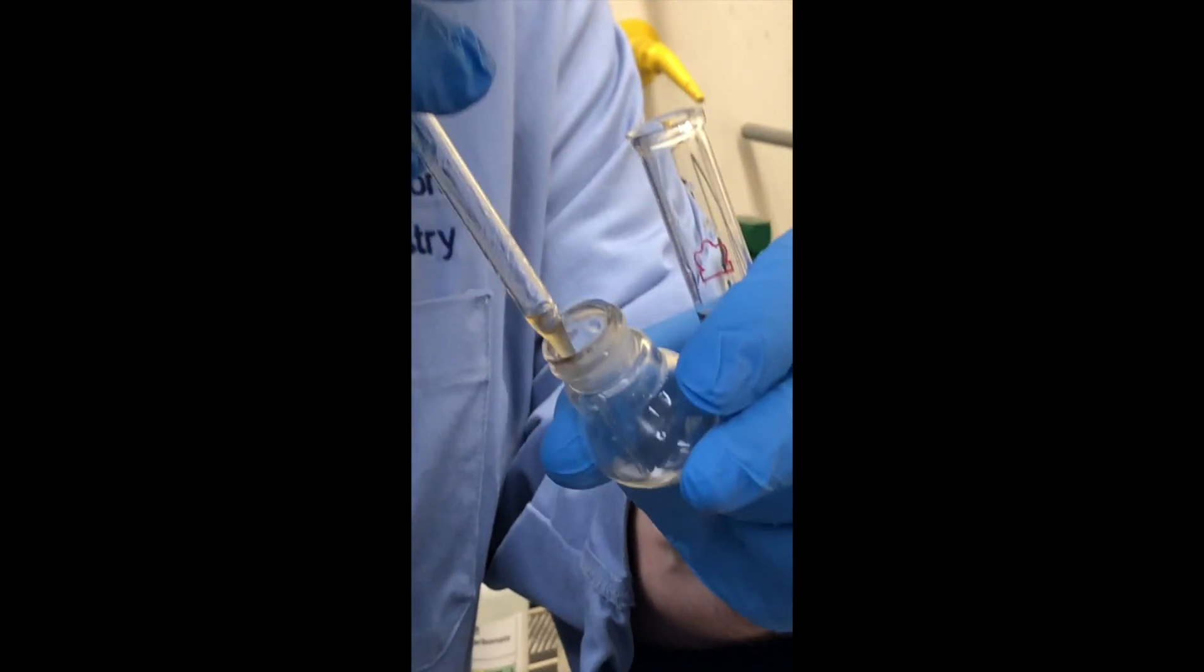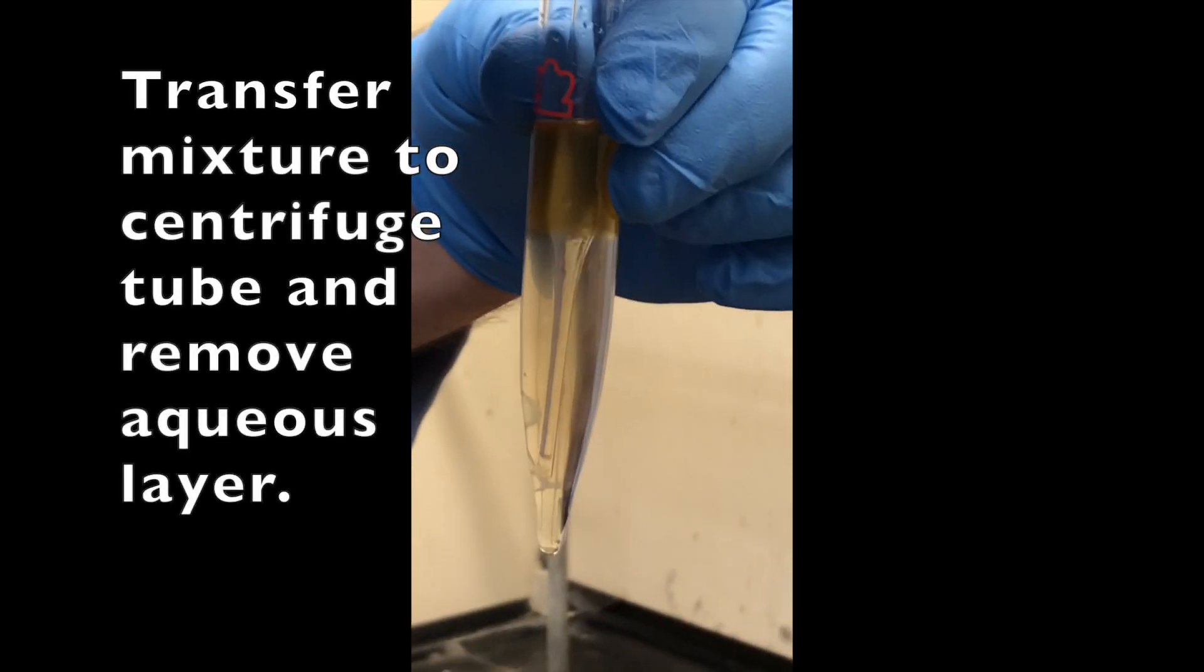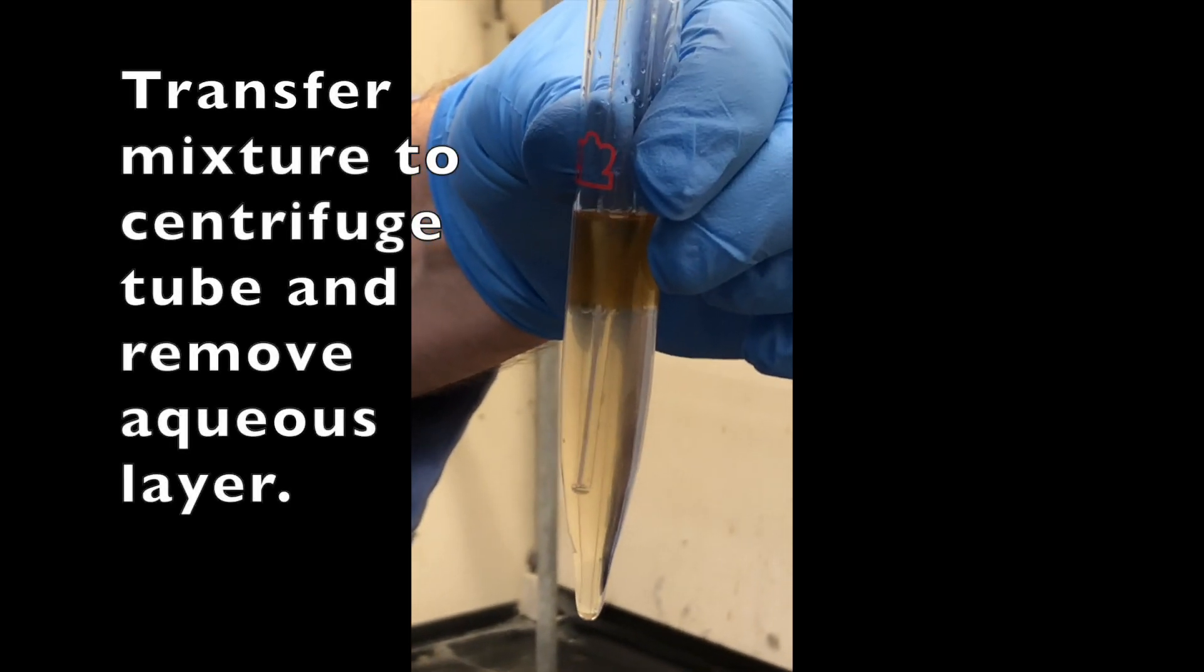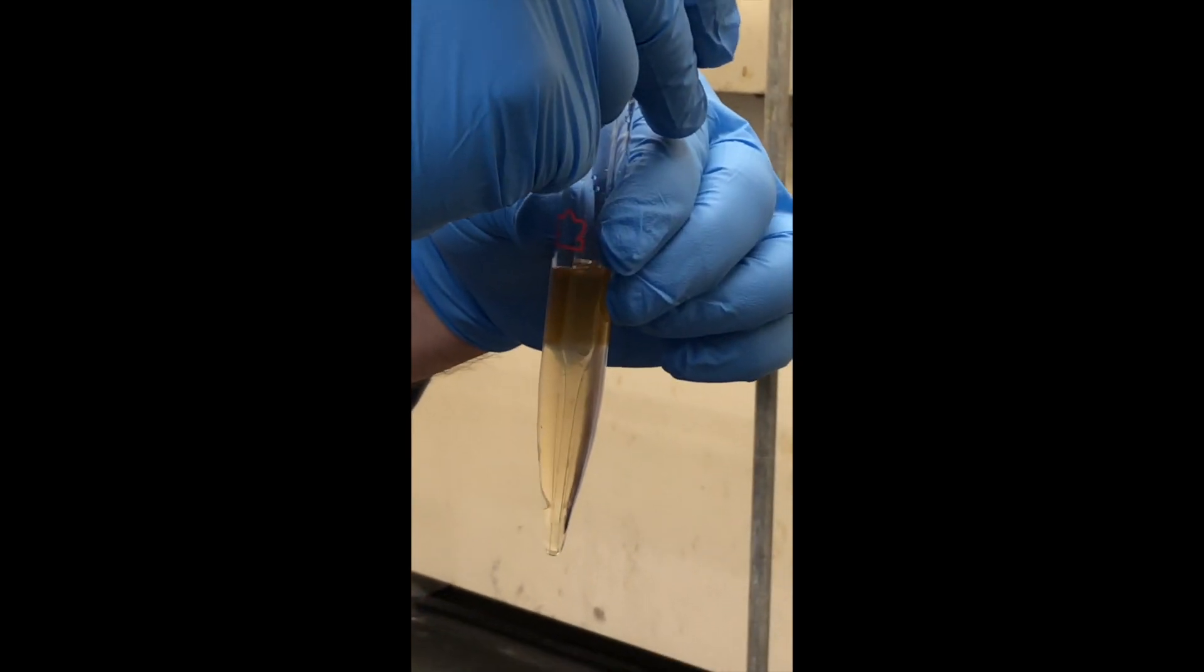Is there any smell to it? It has the smell of vinegar and juicy fruit gum. Now I've expelled all of the air out of my Pasteur pipette and put the bulb, put the tip down in the bottom to remove the lower layer.